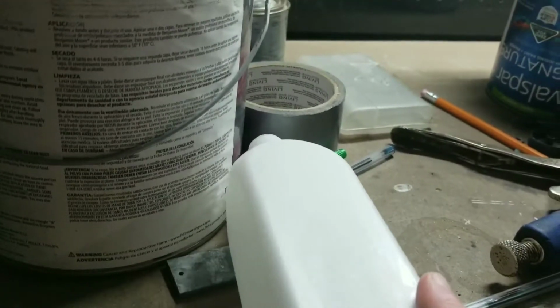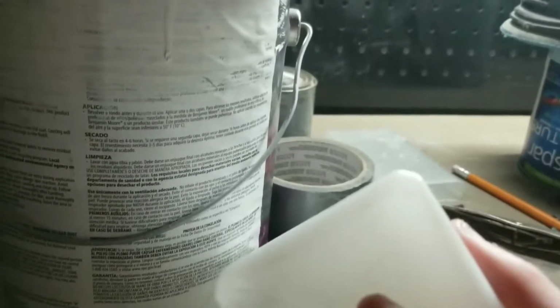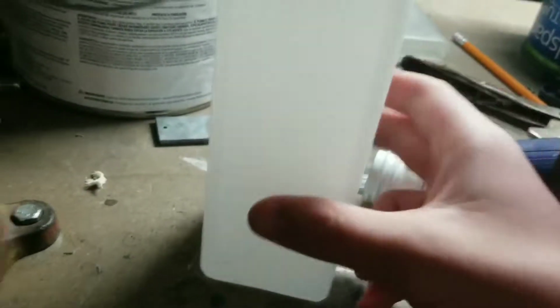Certain plastics aren't, like the ones you use to make water bottles, but this number two recyclable plastic, high-density polyethylene, is used to make acetone bottles, hydrogen peroxide bottles. It's used to make bottles for any dangerous chemicals that you might have in your house. So bleach, nail polish remover, anything like that is made of number two recyclable plastic. And if you're not sure, you can just look on the bottom and see the number two symbol. So this is the plastic that I am going to be building my electrolysis rig out of. And now let's get into it.